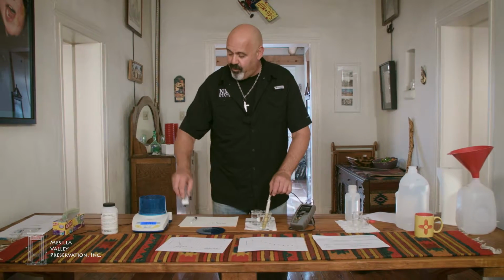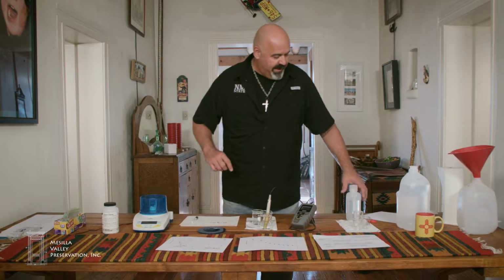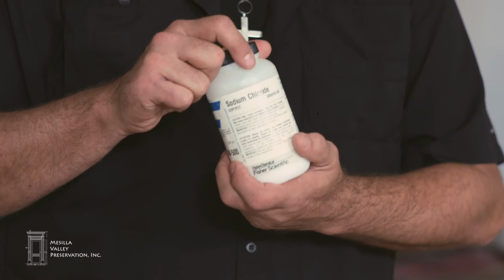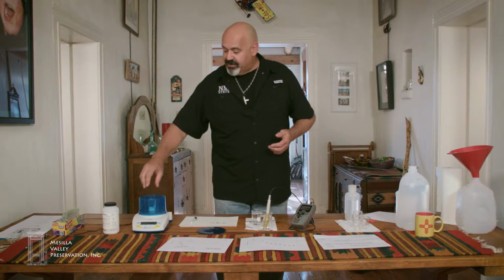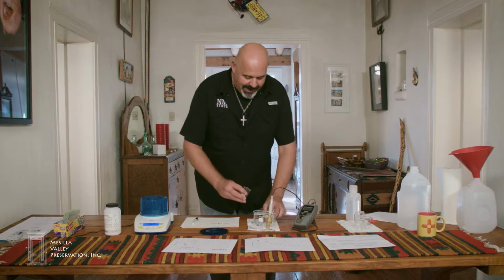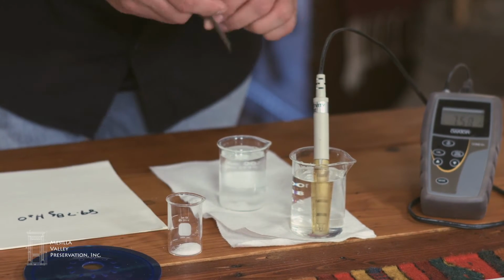I'm now going to put this small beaker of sodium chloride. This is reagent grade sodium chloride from Fisher Scientific. More than likely table salt, Morton salt that you buy from the store will serve the same purpose. And I'm going to tare that beaker so that now as I pour salt out of this beaker, when I put it back on the scale, there will be a negative reading to tell me how much I've taken out. And I'm going to pour about 10 or 12 grams of this salt in here.